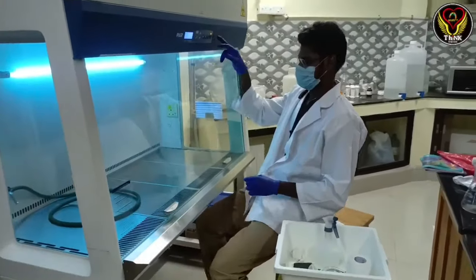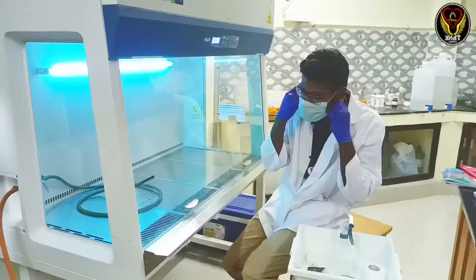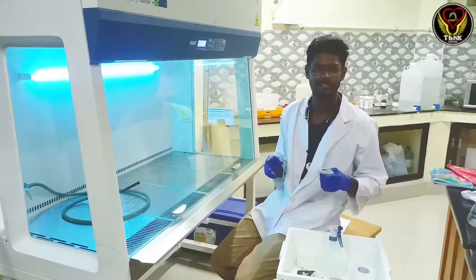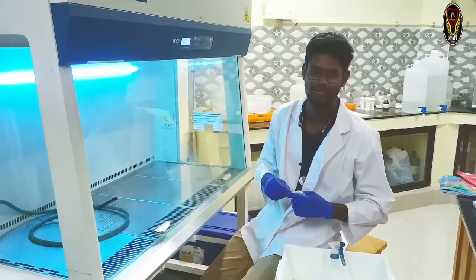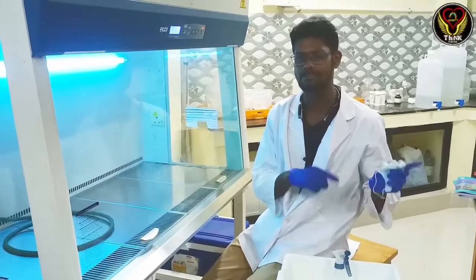Now, we are going to turn on the UV light in the biosafety cabinet and we are going to incubate the plates for 24 hours.